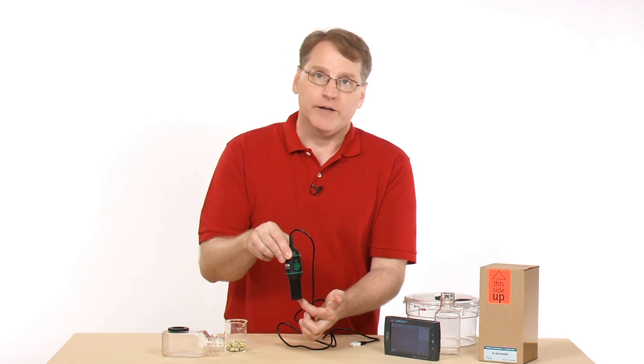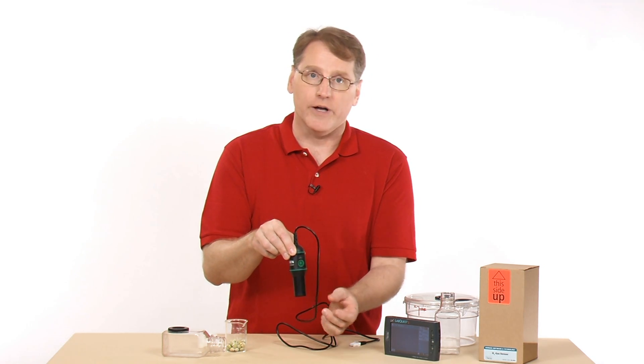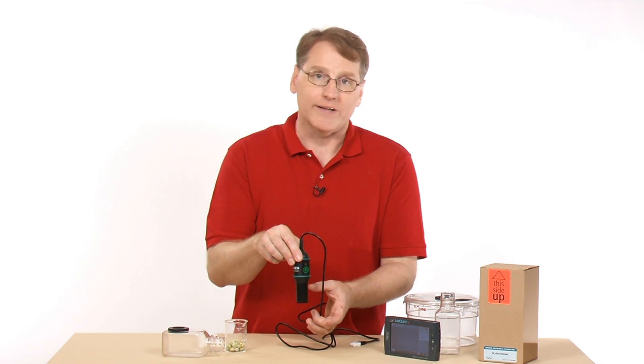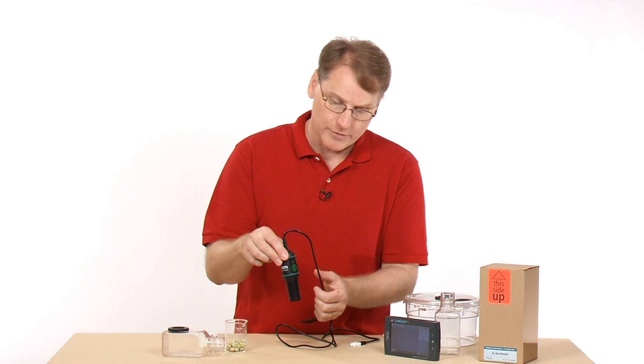The membrane down here, there's a gel that needs to stay across the membrane. Otherwise, you could damage it if you had stored it for long term on its side there. So it's important to be able to do that.